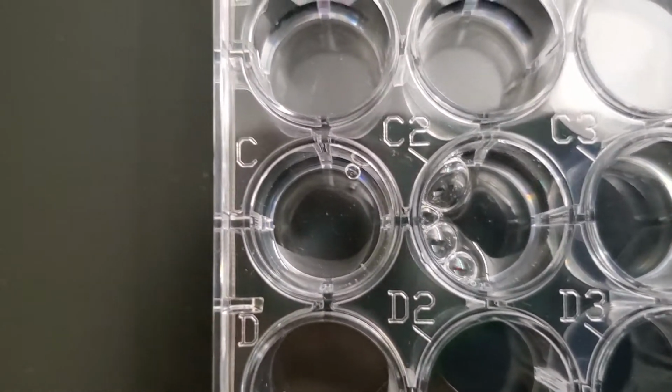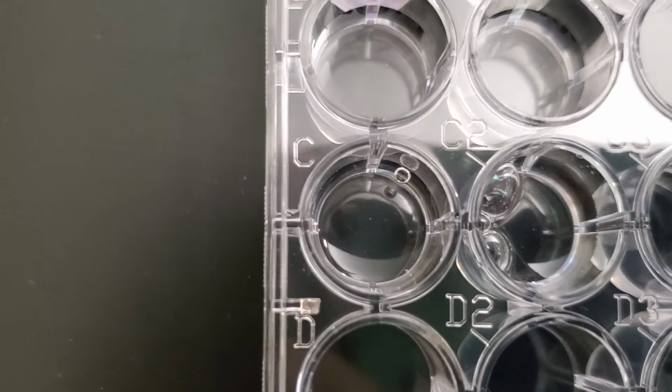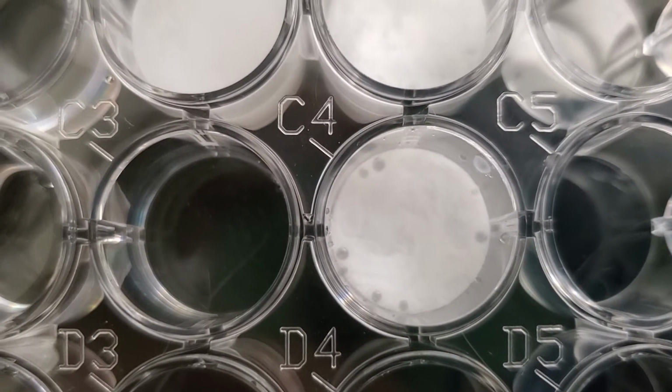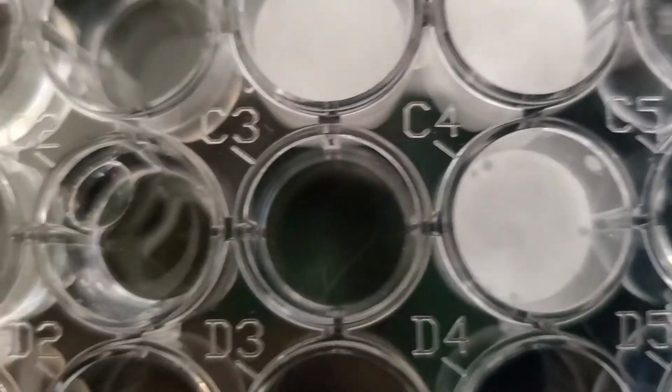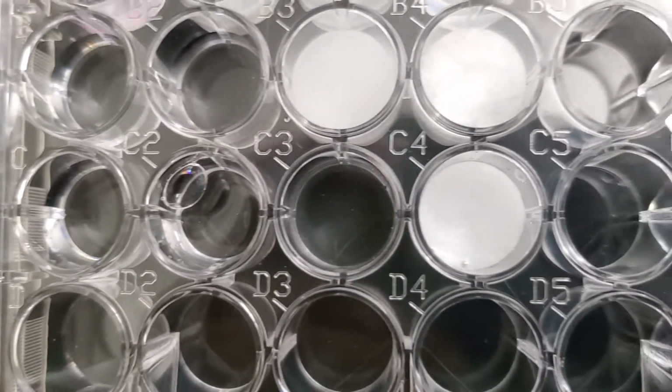I made some bubbles on that one, so sorry, those are my bubbles I made from my pipette. This pipette's giving me bubbles, so neither one of these pipettes is optimal, but it's okay. C3. Okay, you can see C4. And what's happening with C4. Okay, so once again, this is adding potassium iodate to each one. So there's C1, C2, that bubble was created by me, C3, and C4.